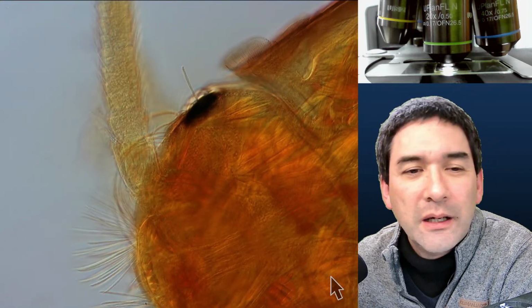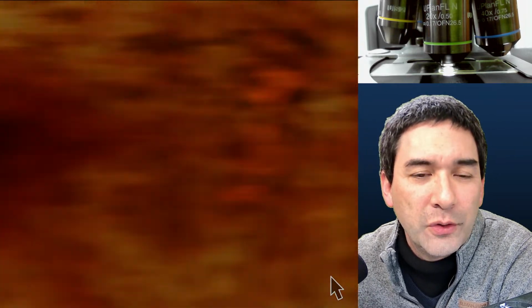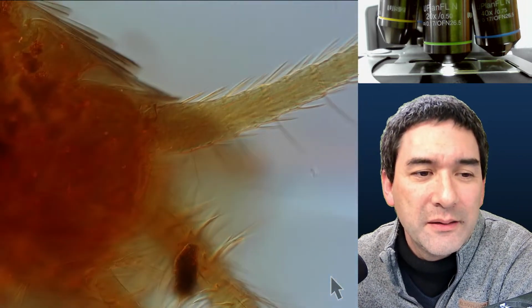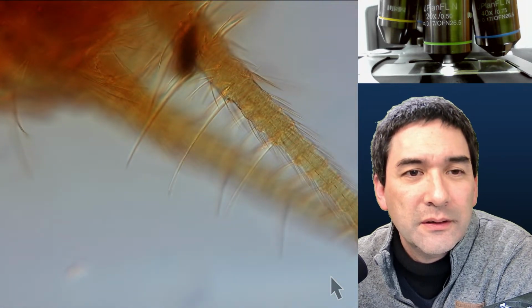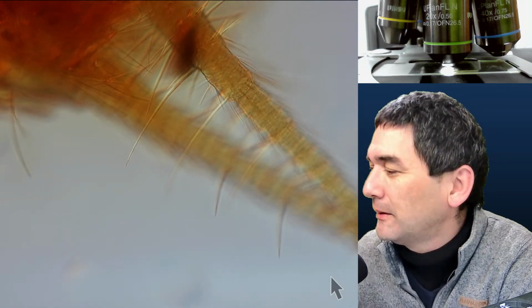The comment here is they look pretty different when mounted on a slide. Yes, the mounting medium makes a huge difference, but this one has already been preserved on the slide for quite some time, several months. Actually, it's a very sloppily made specimen, so I'm a little bit surprised myself that it got preserved that well, because it's fairly thick, as you can see here.